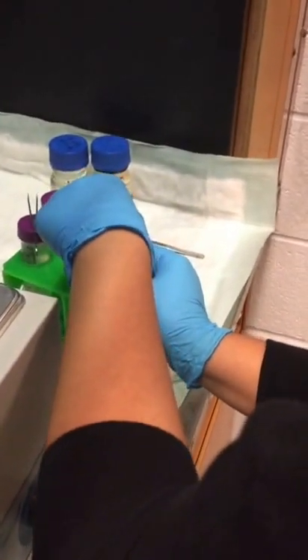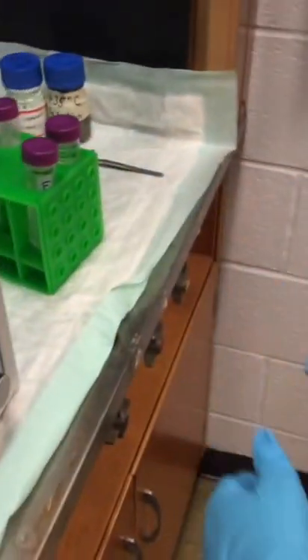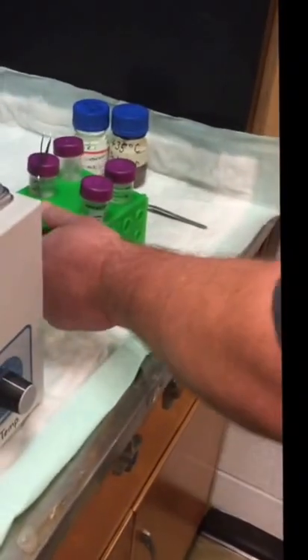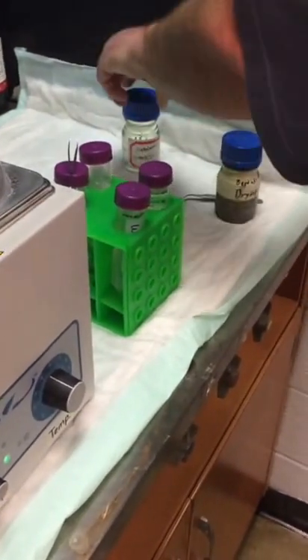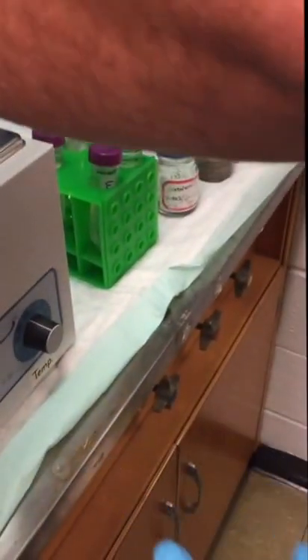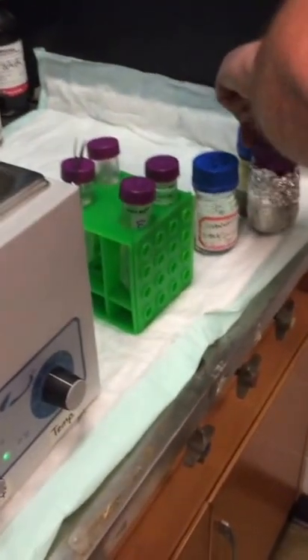So are we on the last wash cycle? Yeah. So you have your acetonitrile — the drying solution right here. We want to do the acetonitrile first and then the drying solution. So this is acetonitrile.